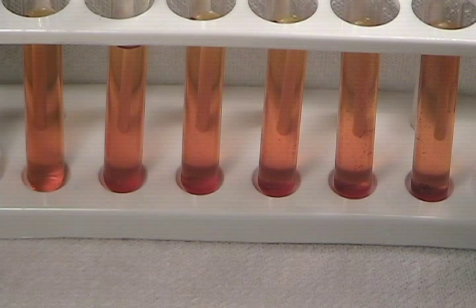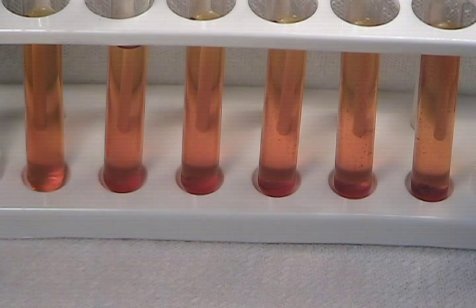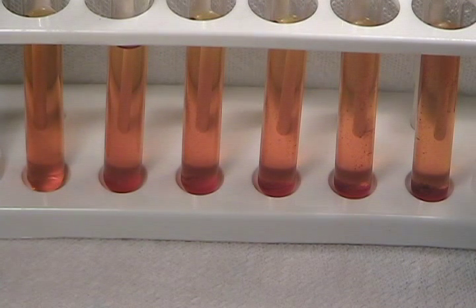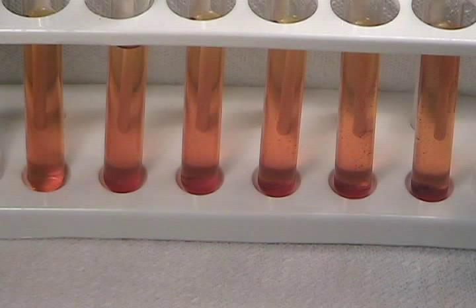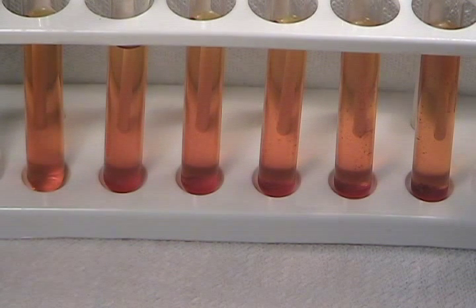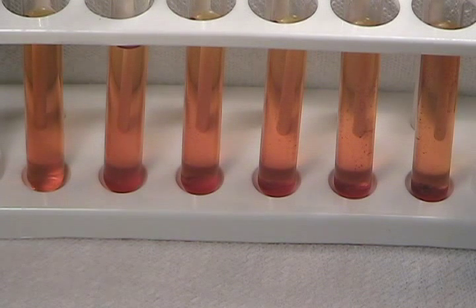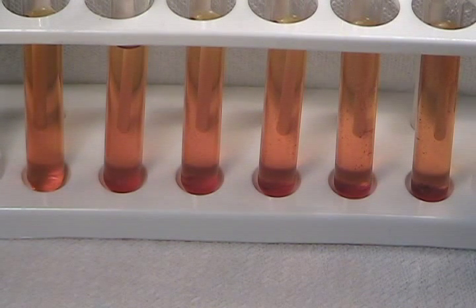What's interesting is that the second test tube from the left, the five parts per million quinine solution, originally appeared clear with just a slight color change. It now also has a noticeable precipitate at the bottom of the tube. The test tube on the far left contained only water and shows no precipitate whatsoever with the Dragendorff reagent.